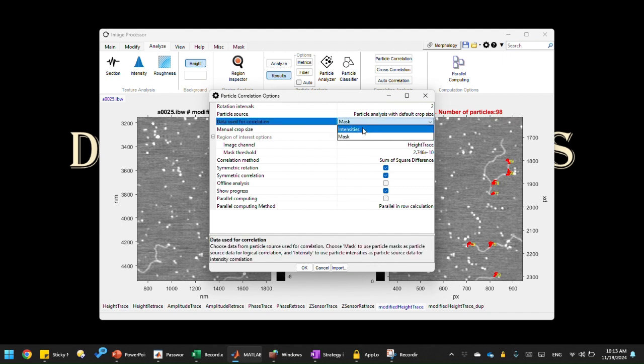By default, it's using the intensities. Okay, so you don't want the intensities. You want to use the mask. That way we only use the mask of the particles for our correlation analysis instead of using the raw data. Like I mentioned, we don't use the raw data. You need to use the mask, so that's why you pick up the option here. Pick the mask, and this particle source will pick the default. Particle analysis with default crop size. Then you click OK.